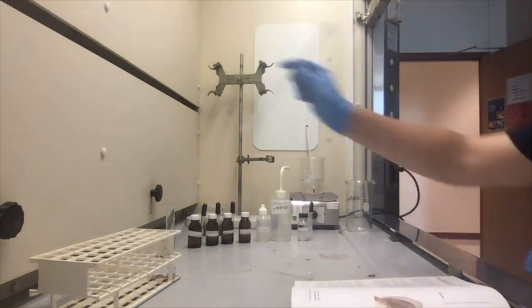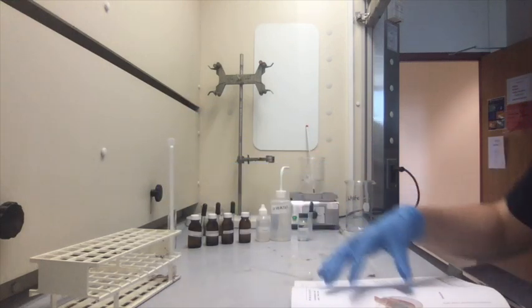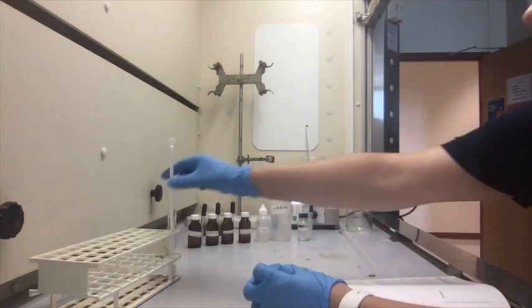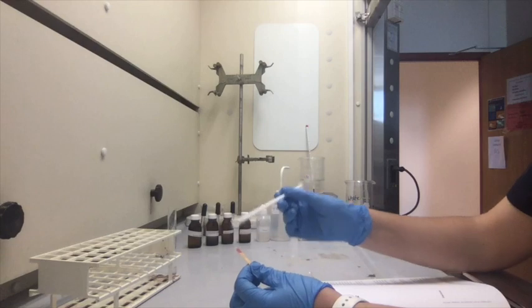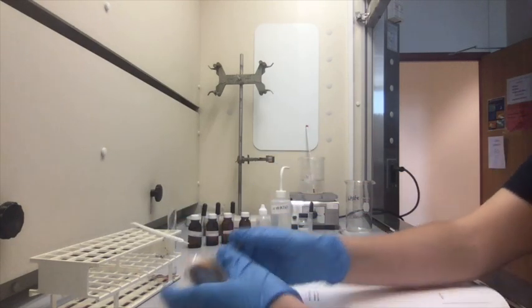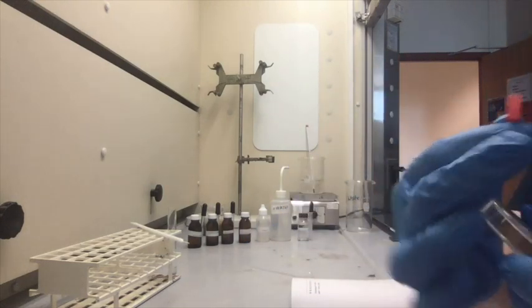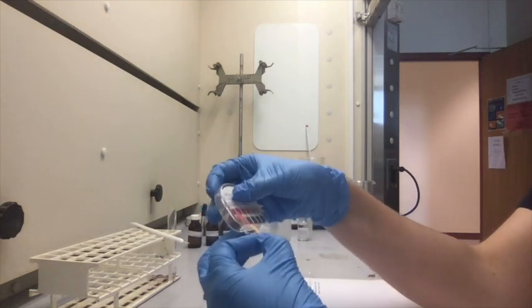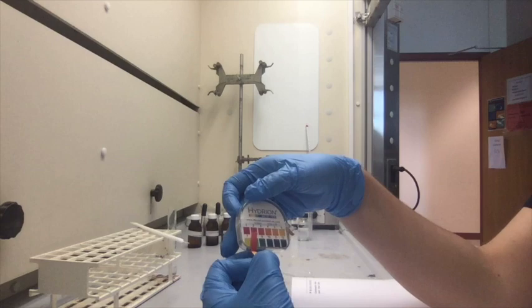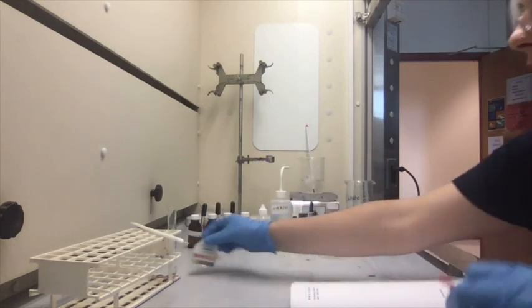So now we're going to take the stir bar, swirl it in the solution. We're going to take a little piece of pH paper and then place it on here. And that'll give us the pH of our solution by looking at the indicator, the scale here. So when comparing it, it's probably about a pH of 2. Between 3 and 2 on this scale.